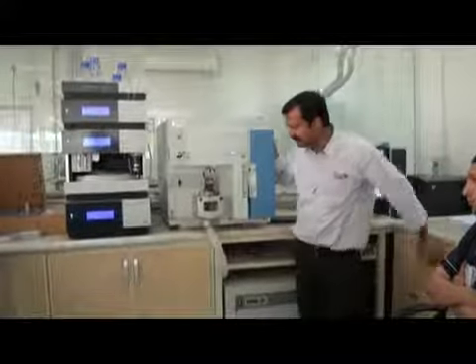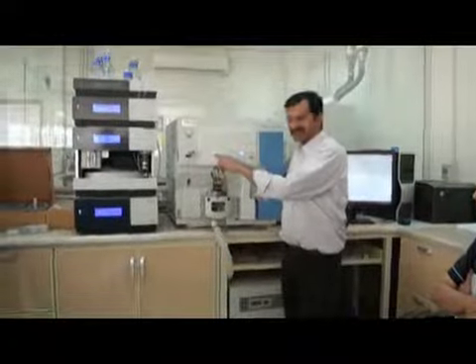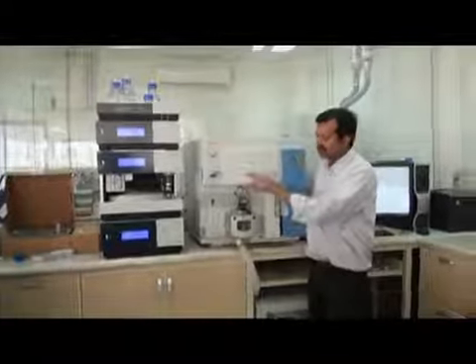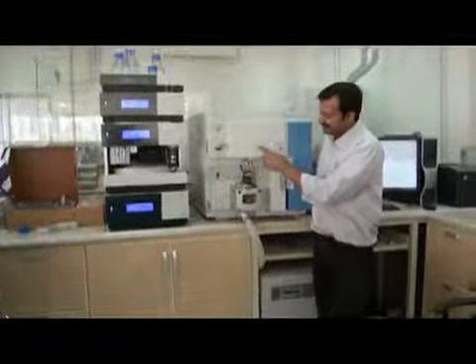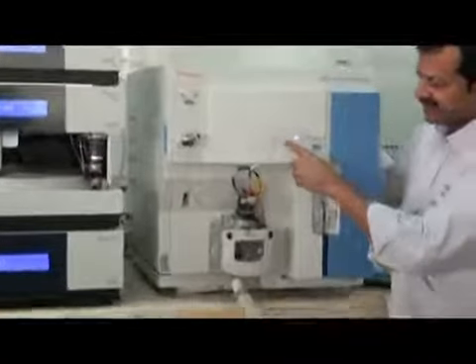Okay. So this is the power light. If there is power, this light will be on. This is the vacuum light. If your vacuum is good, this will give you a green light. Otherwise, it will give you an orange light. This is the communication light. If your machine is communicating with the software, it will be on. This is the system light.